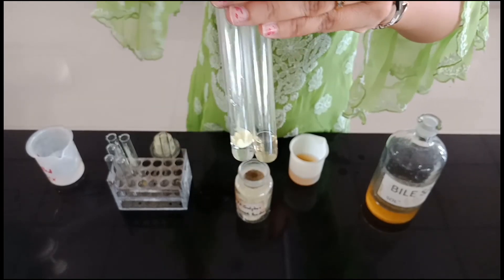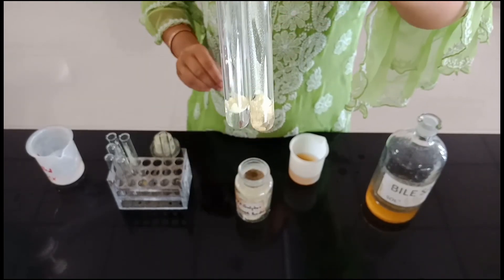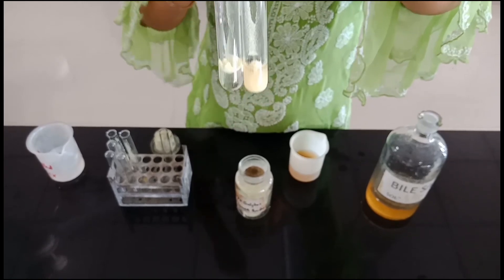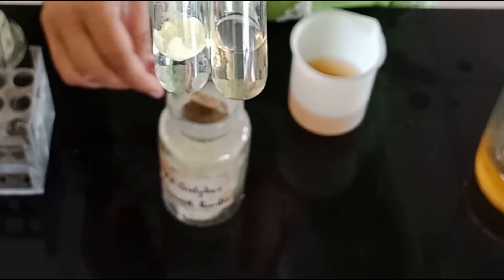You can clearly see that the sulfur flour powder sinks to the bottom of the test tube which contains the bile salt solution, because the surface tension of the bile salt solution is lower than that of water.